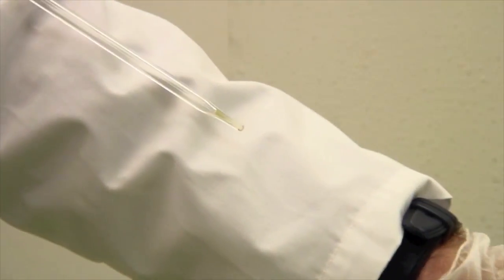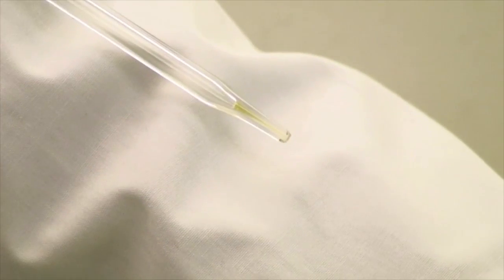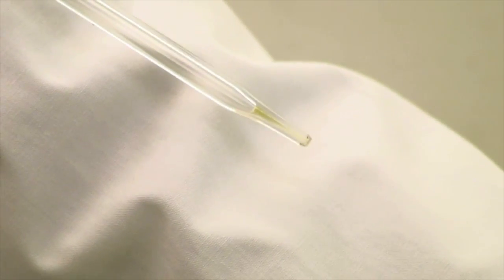There is some liquid still in the tip of the pipette. Do not blow that out. The pipette is calibrated to retain that little droplet of water.